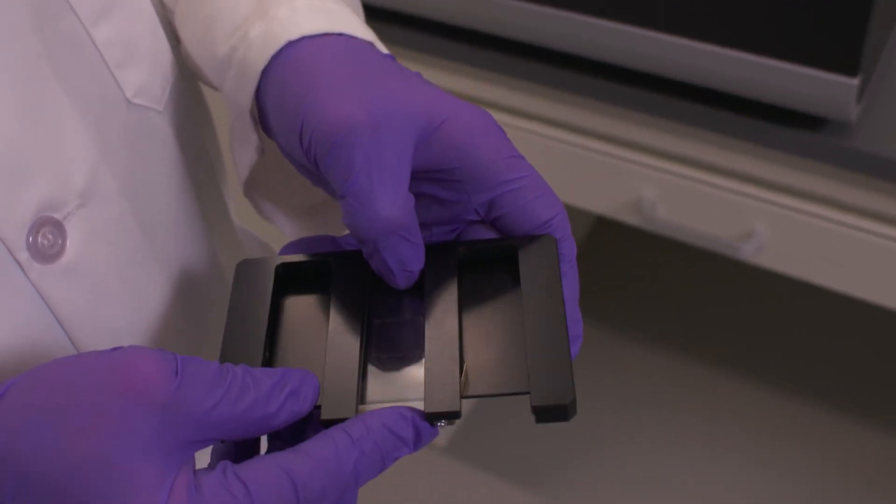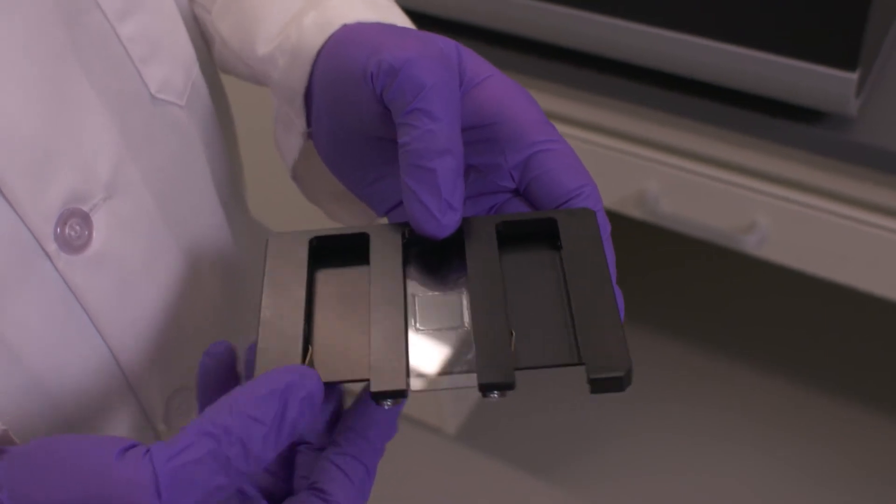We're going to slide this in place, make sure it's flush with the top here. We're now going to turn this over.